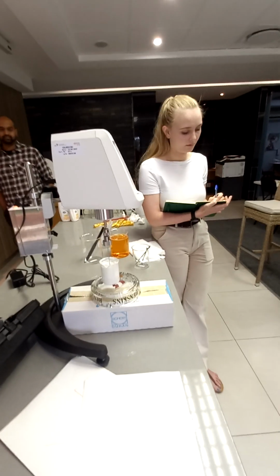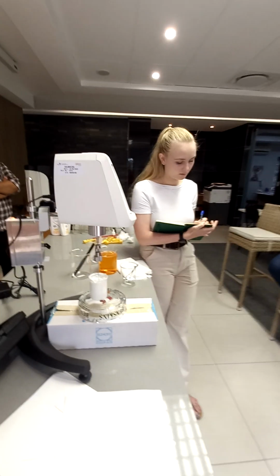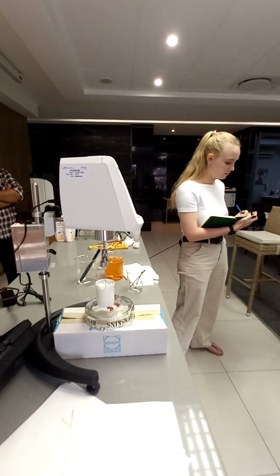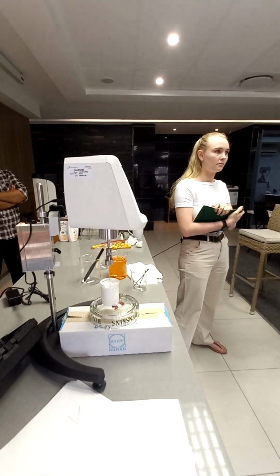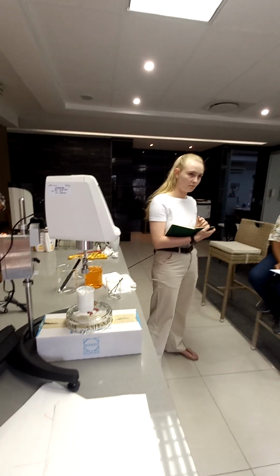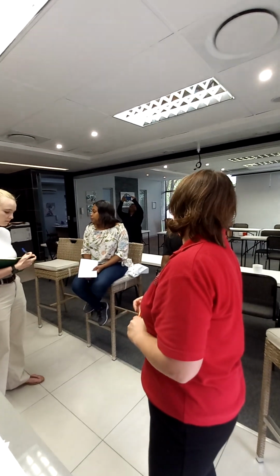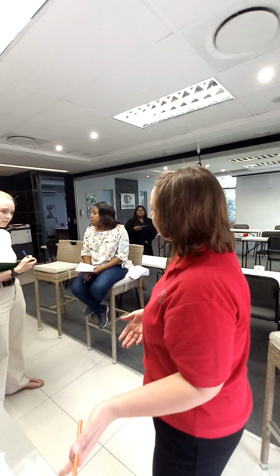So that's why if you do a test and you take a reading after 30 seconds, but you do a test and you take a reading after 1 minute, you can have different results. So that is why you've got a time function. So you would always take your reading after a certain time because your sample is time dependent. Some samples are not time dependent and you don't need a timer, but some are. Is that okay? Yes.